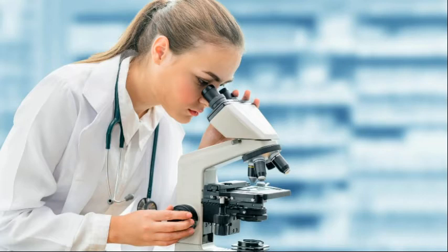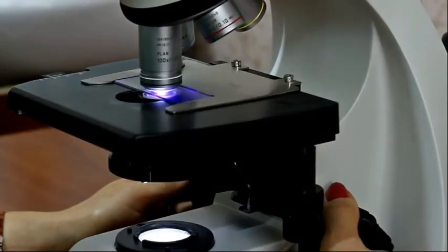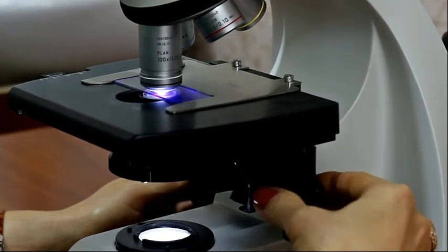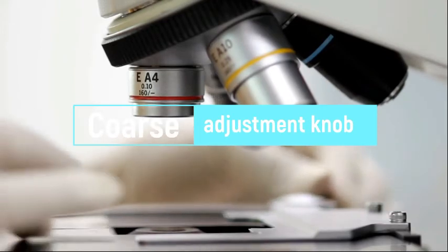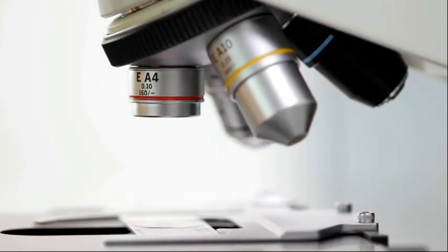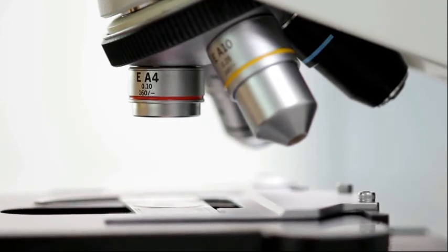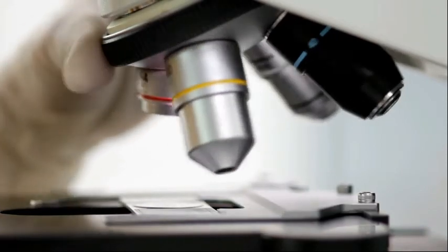The adjustment knobs are made up of two components. The coarse adjustment knob is used for bringing the object into proper focus — it controls the stage, moving it upward and downward so that you can bring it closer to or farther away from the lenses.